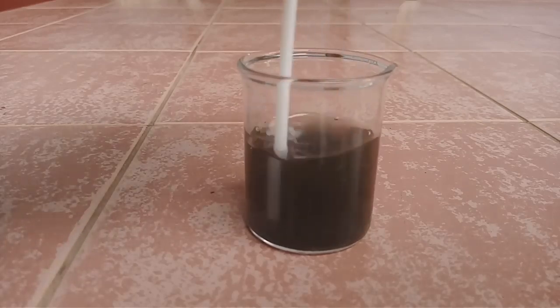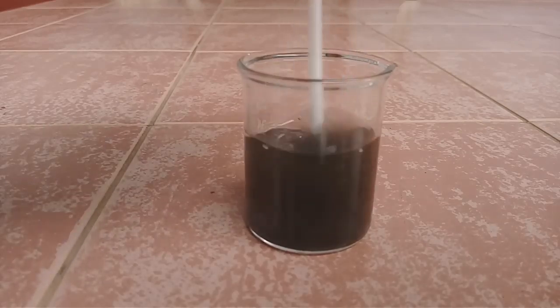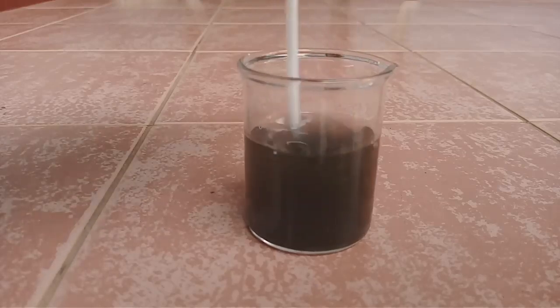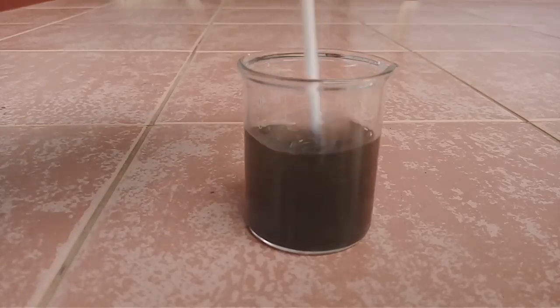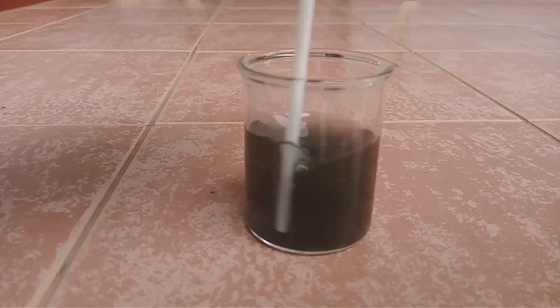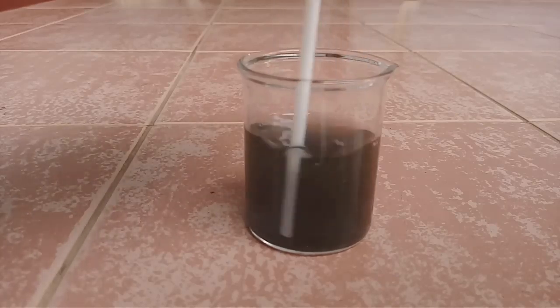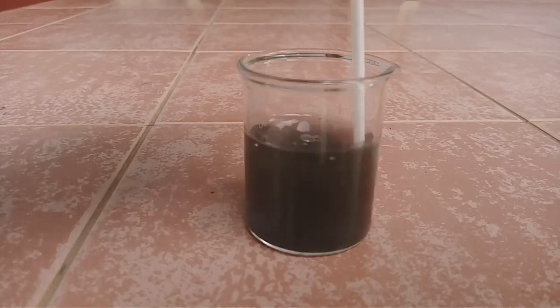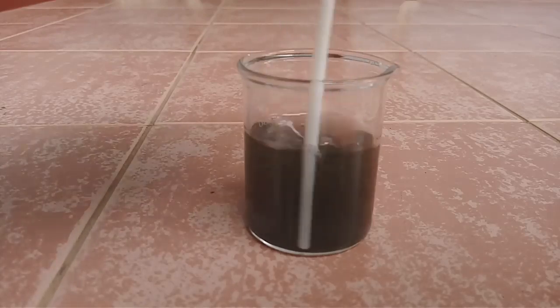You must do this experiment in outdoor or in a fume hood because this reaction gives sulfur dioxide gas. Sulfur dioxide is a toxic gas.